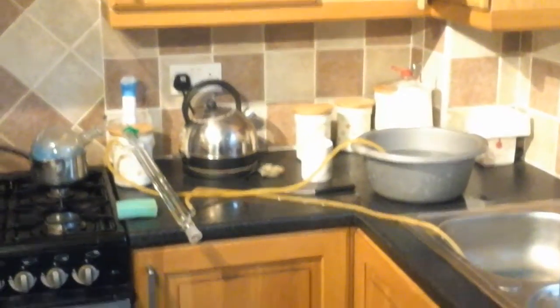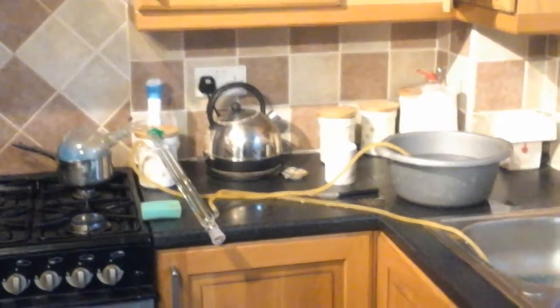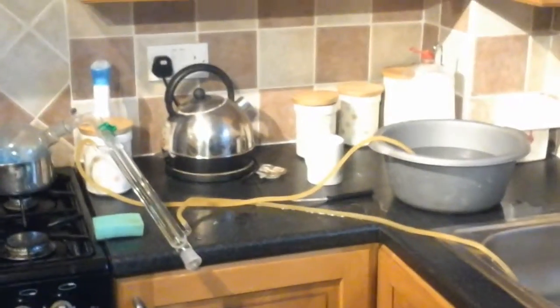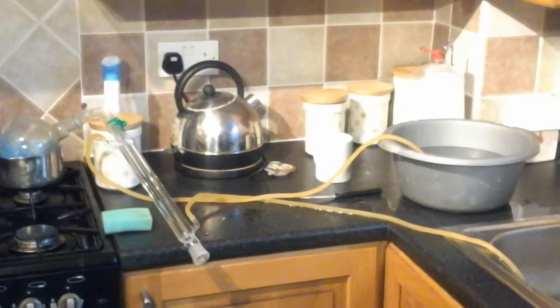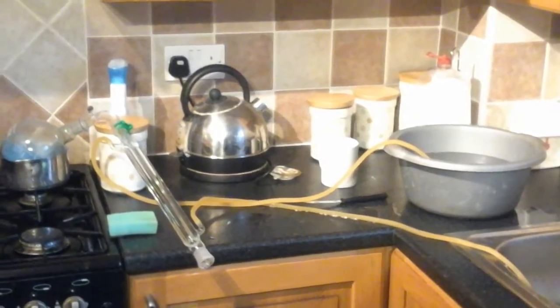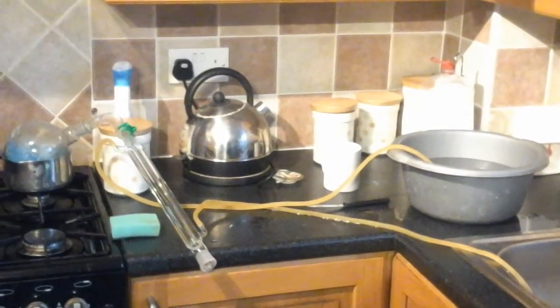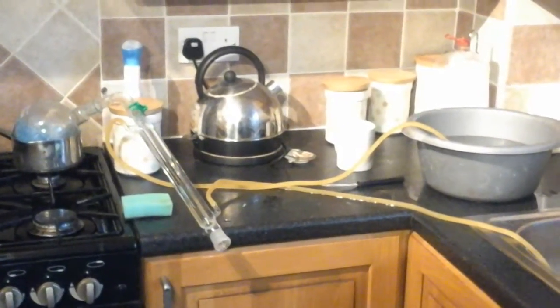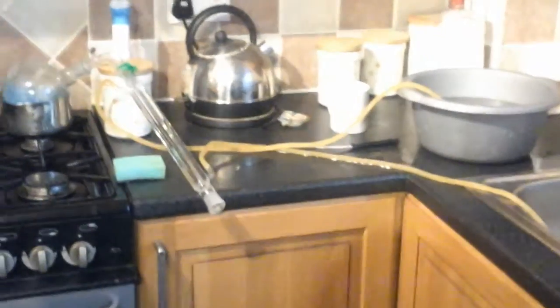In this video I will explain how to really screw up a distillation. I've recently been doing some experiments involving turning 3D prints into tin cast objects using large amounts of dichloromethane in the process, and not wanting to waste it I thought I would distill it and reuse it.